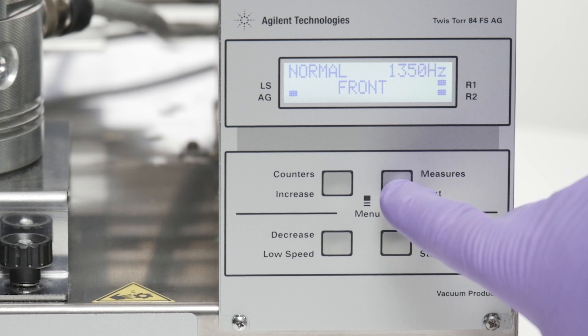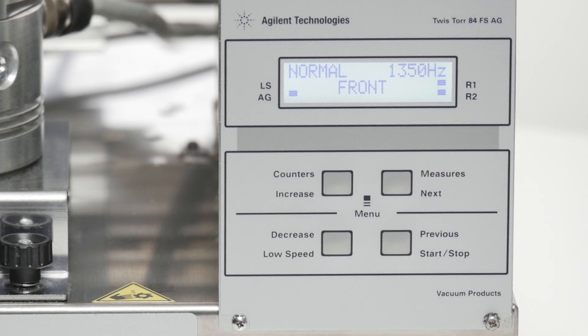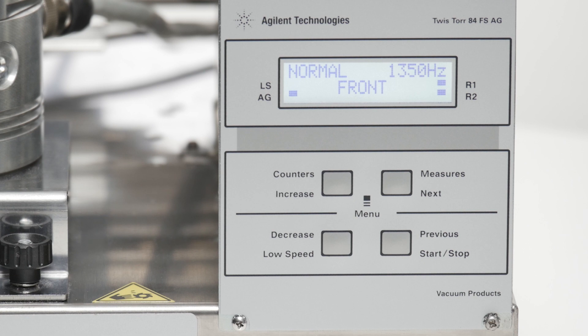I want to give you some idea of what happens when we introduce a gas load to the system. And the best way to demonstrate that is by running Agilent's T plus operating software.